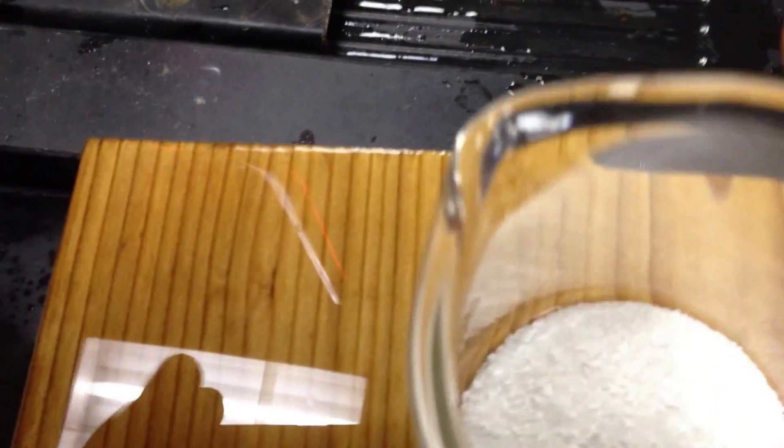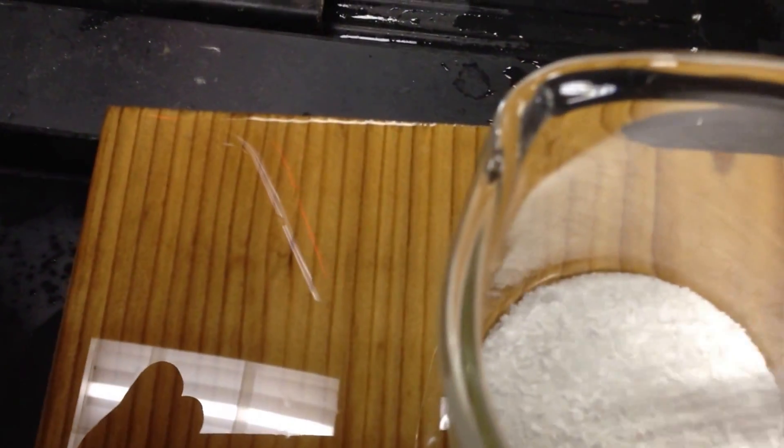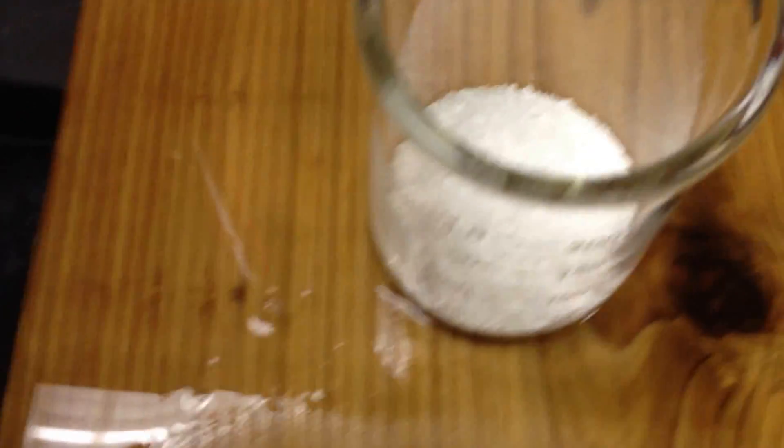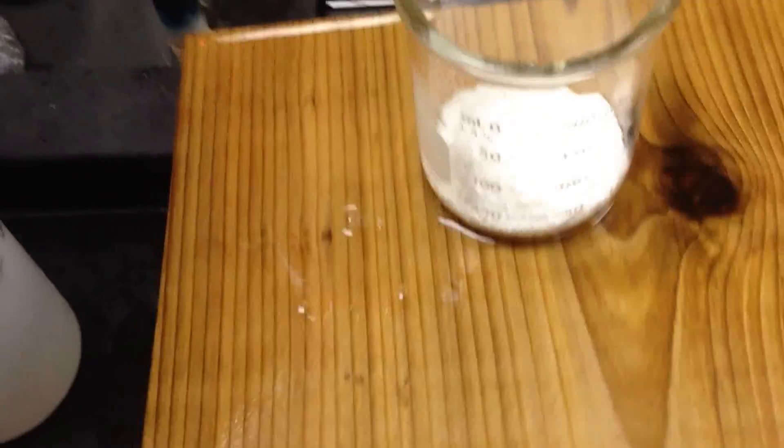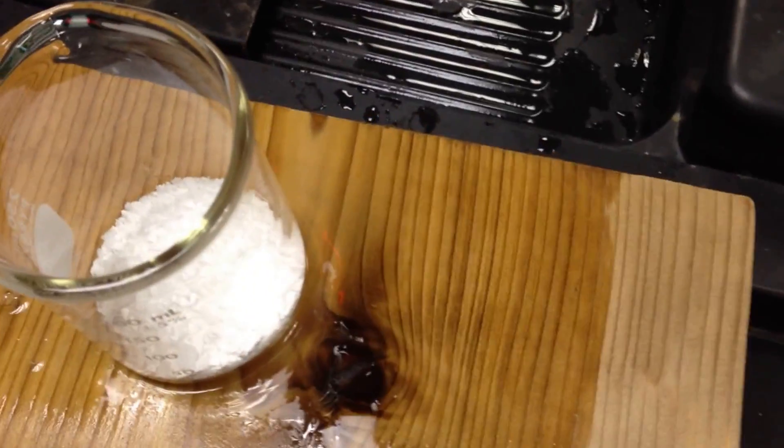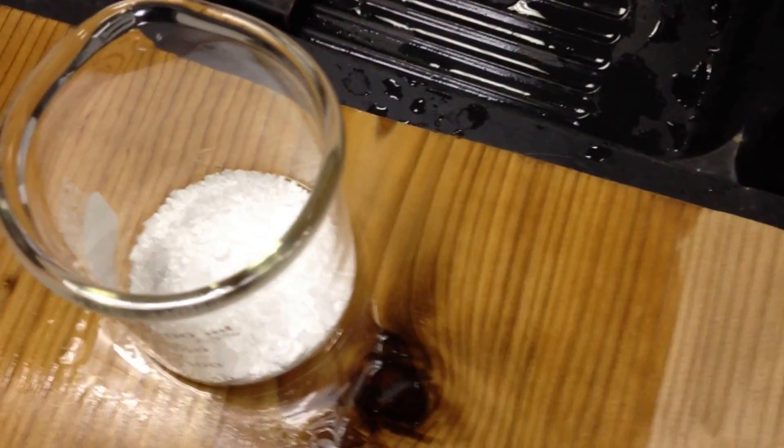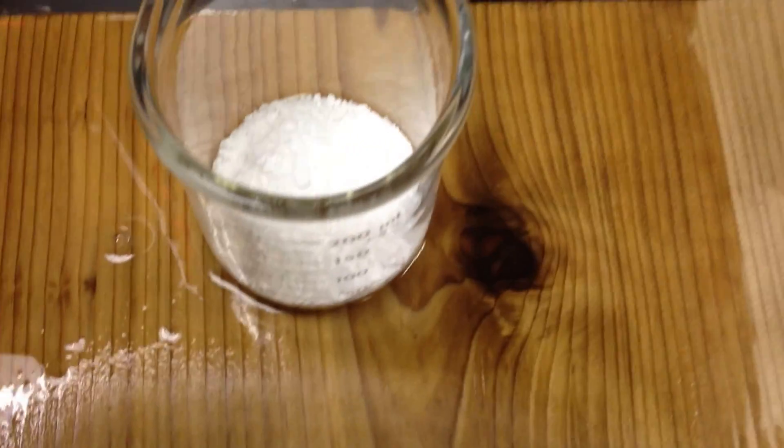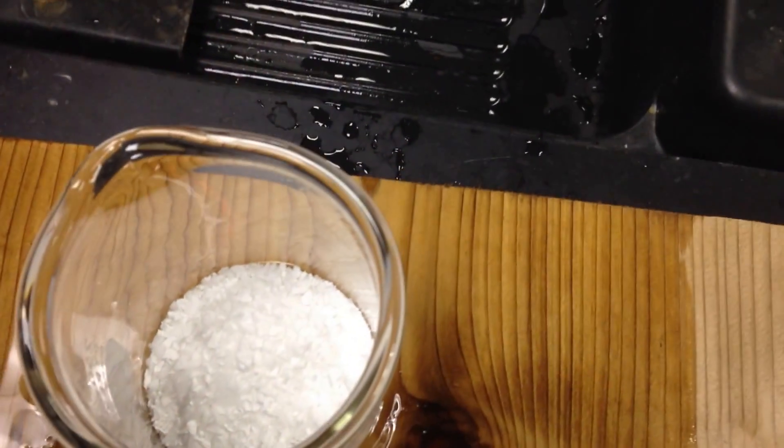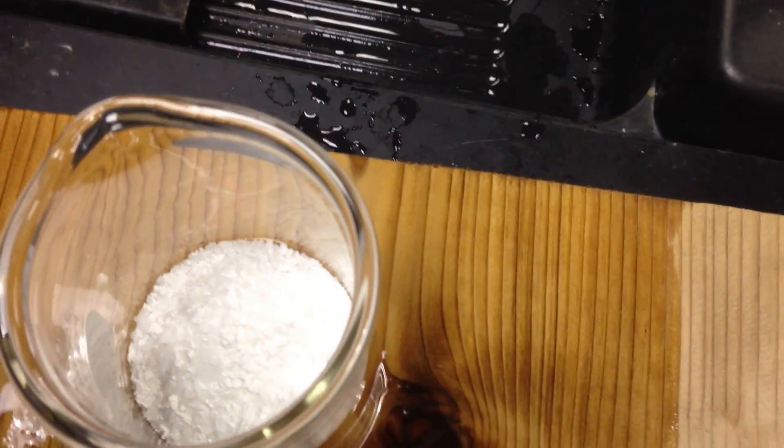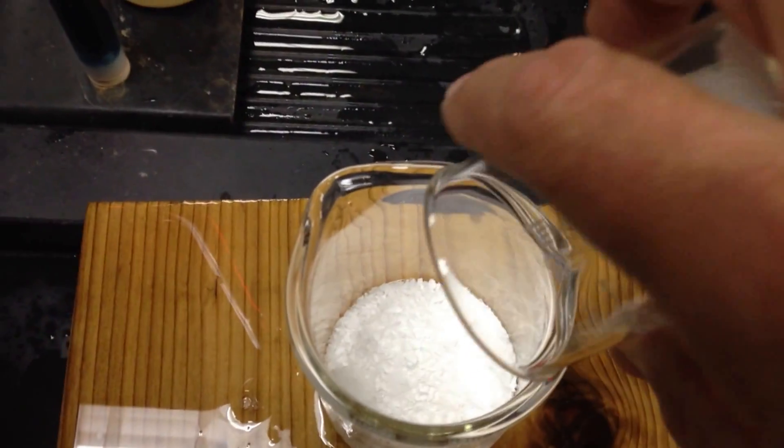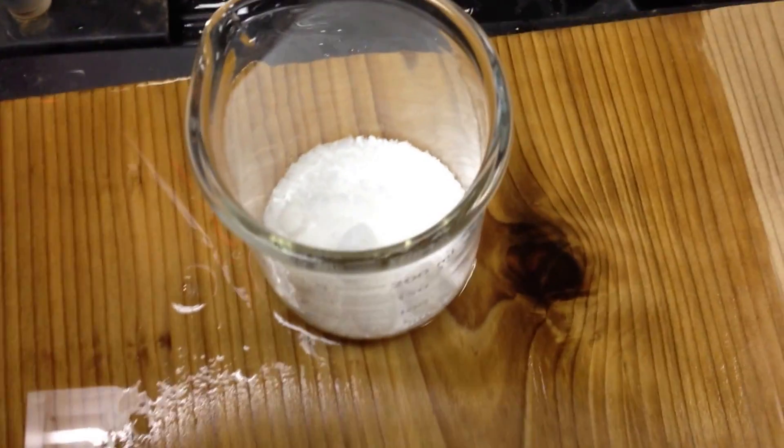All right. Now we're freestyling. Hold on. I was so prepared I wasn't. So let's add another compound. Stay with me. Can you take this off for me? Here we go. Saran wrap is a... So here we go. Two different compounds now.